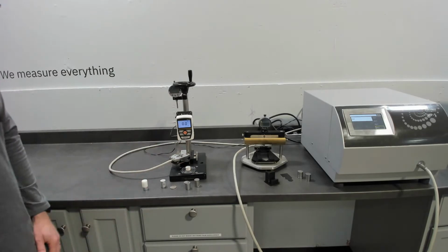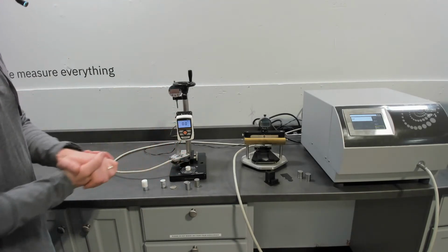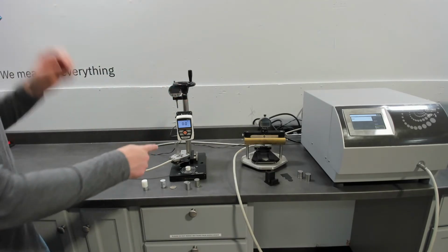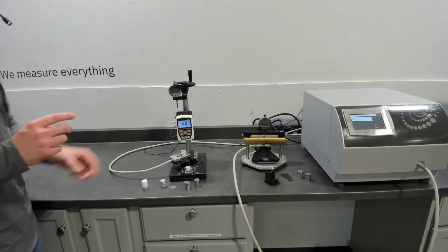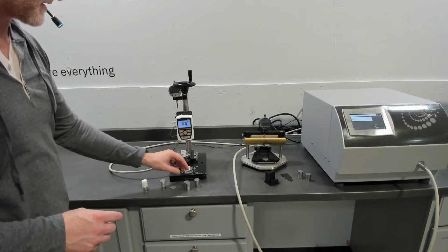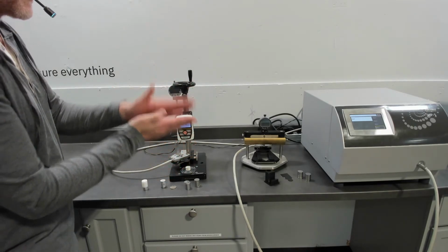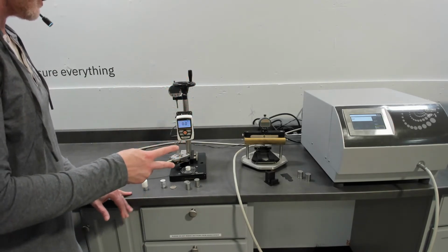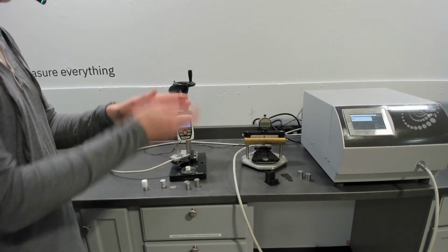I'm going to do a sample setup. This is our compression stand. You can vary the height of your samples, and we're going to do 5 pounds of pressure. We've already measured that same setup with 30 pounds of pressure, so we'll be able to compare the dry contact resistance between piece A and piece B, of a similar material with polished and sandblasted surfaces together, with 2 different pressures. And then we have some data to show on 2 pieces of polished under various pressures.